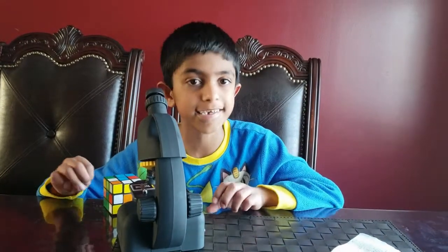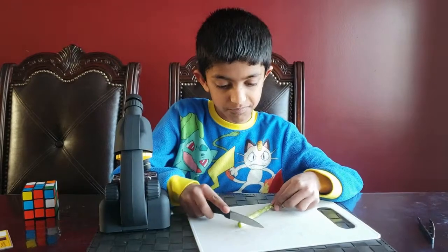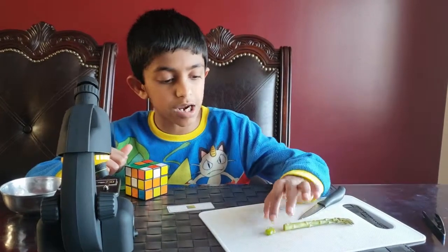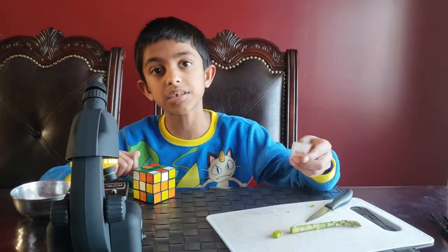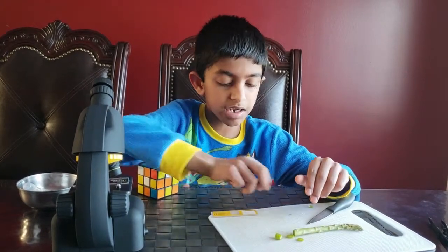And today, I'm going to cut it into thin slices. Today, we're going to make the specimen. So, I have my asparagus here, and now I'm going to cut it into thin slices. I have some very thin pieces of asparagus. Time to make the specimen. Get the specimen glass — this is the specimen slide — and now, we're going to put some asparagus in it.